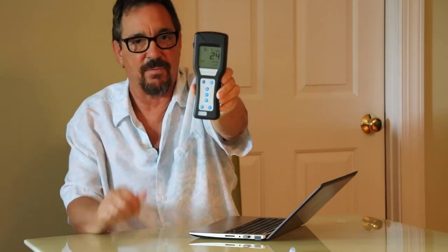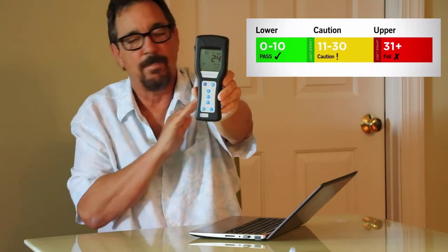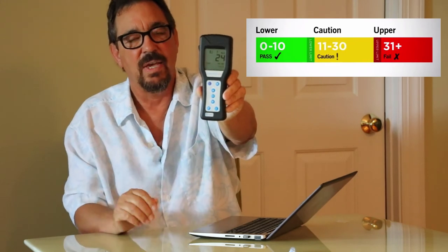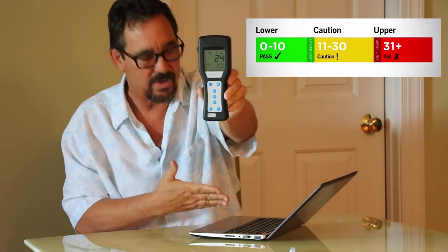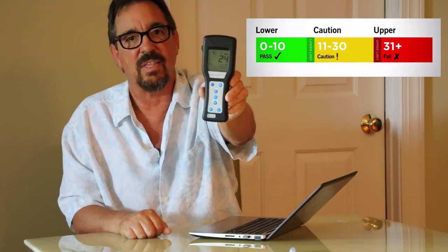A 24 from a 259 — if I wanted to spend more time cleaning the surface, I only spent a few seconds. I sprayed it down first, scrubbed it a bit like we would on a real job, and quickly wiped it down. Remember: between zero and 10 is perfect, 11 to 30 is in question — so I would clean the surface again — and anything above 30 is gross.